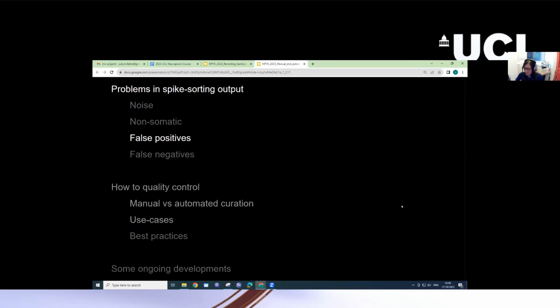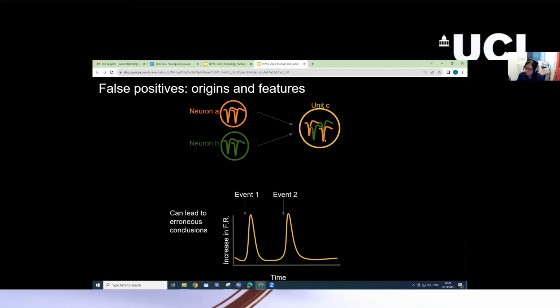Okay, so these were kind of the easy problems to spot and solve. A little bit harder is detecting when there are false positive and false negative spikes inside a unit. So false positives occur when the spikes from two different neurons, see here neuron A and neuron B, are incorrectly merged into the same unit, unit C here. And again, you could falsely conclude, for instance, that one neuron is encoding two different events, perhaps as multisensory, when in fact, there are two different neurons that are encoding each of these events.